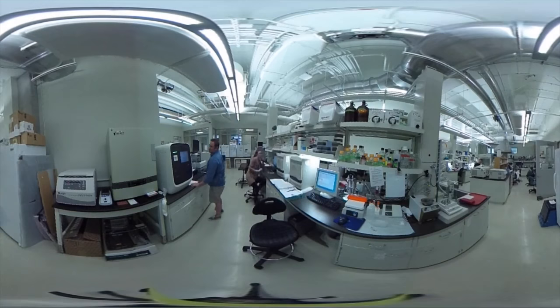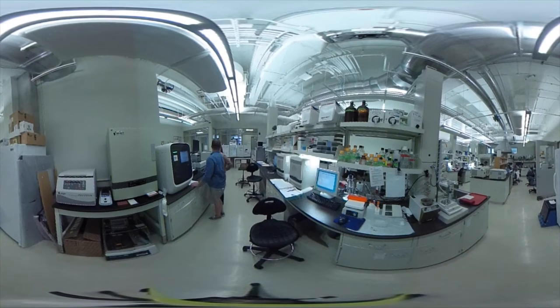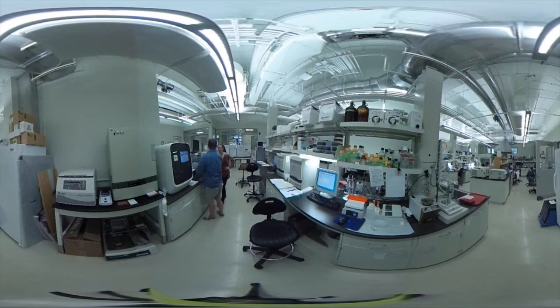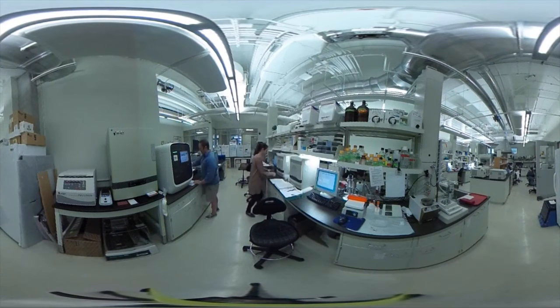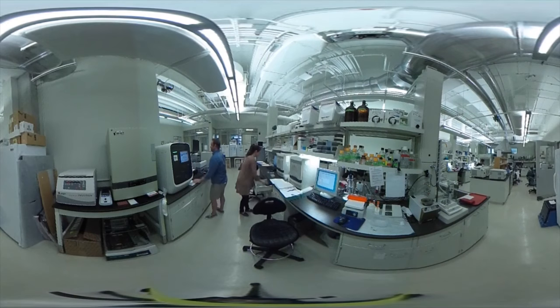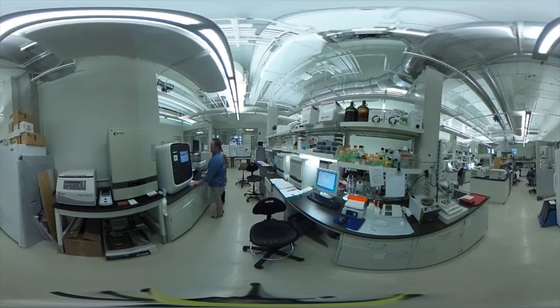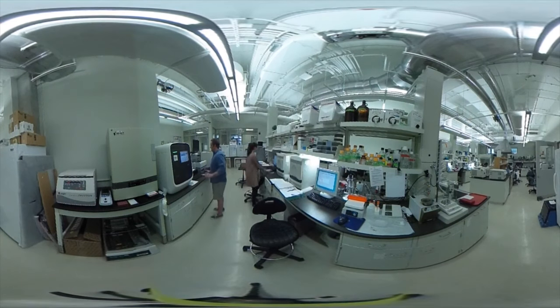These machines are the workhorse of gene expression analysis. When you want to look at what's different between a normal cell and a cancer cell, or what makes a lung cell a lung cell and not a stomach cell, these are the tools that let you get in and actually look at the expression differences within a cell.